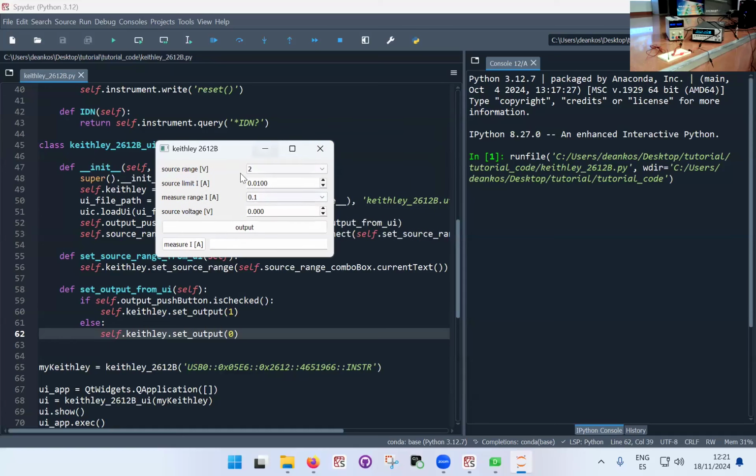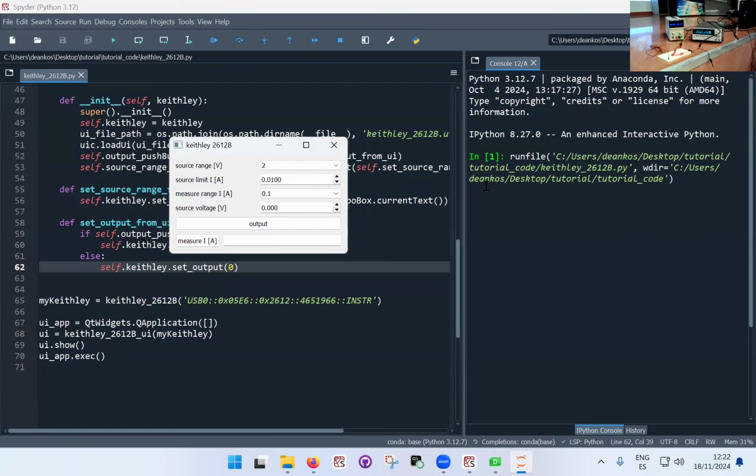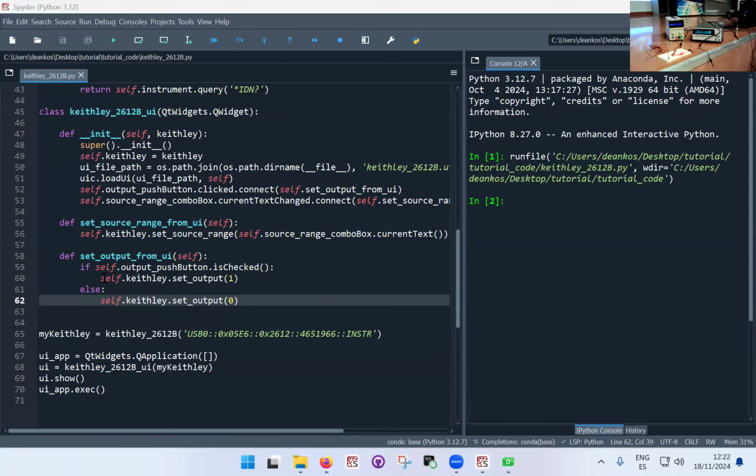One thing to notice is once you execute the UI, this will generally block the text interface. Okay, so you will have to close it because the Qt application is running. This is what happens for the command line here. Basically, there's a program running. Okay, so it's running something, so it can't take your commands because it's already executing something else. So that's why here, if I wanted to, I can't really type anything because it won't let me. I need to close this first. Okay, so that's pretty much it.